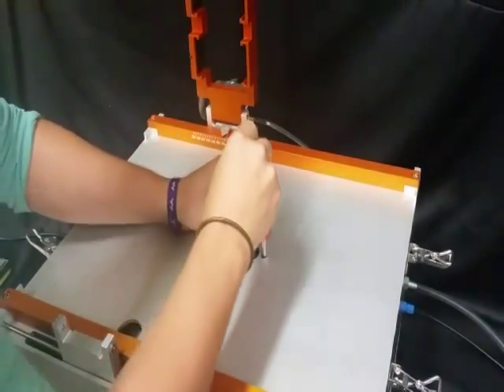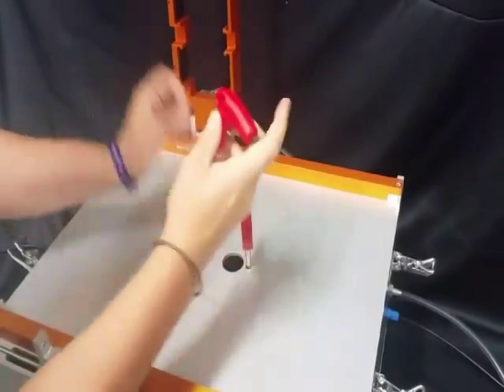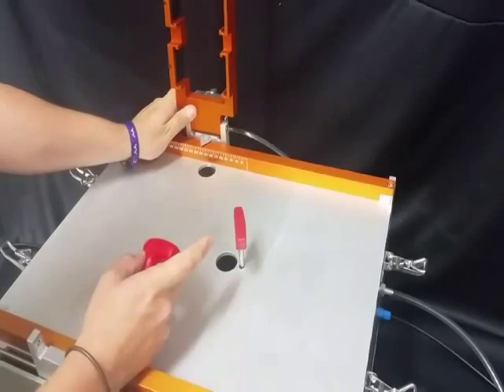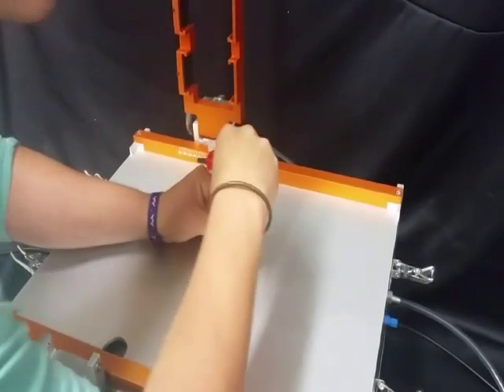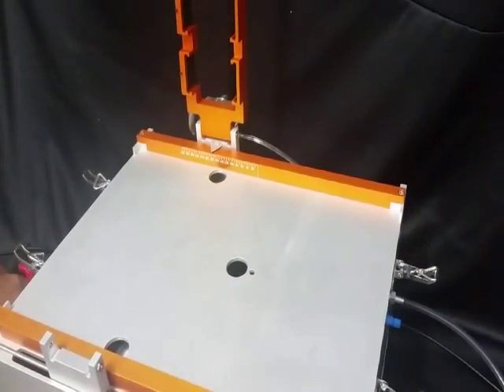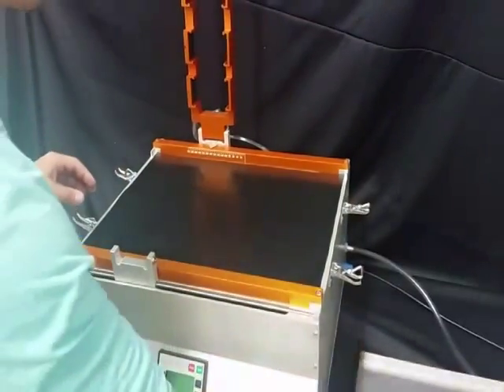Next, you will use the hexagonal wrench to loosen the two carriage securing bolts in hole B. Then you will push the carriage to the desired stroke length. We will be setting it to 180 millimeters to fit our test panel. Then you will re-tighten the bolts and refit the mat and the tray.